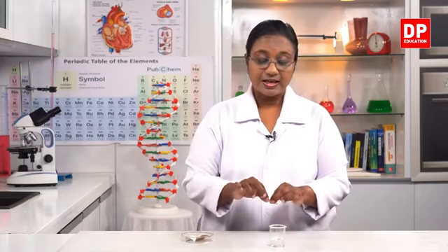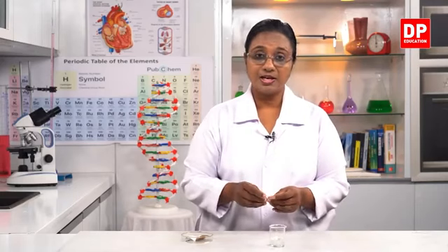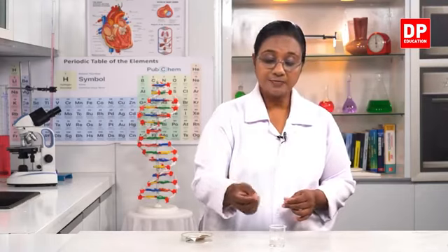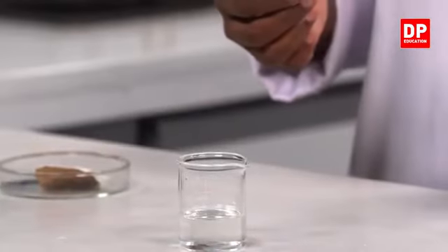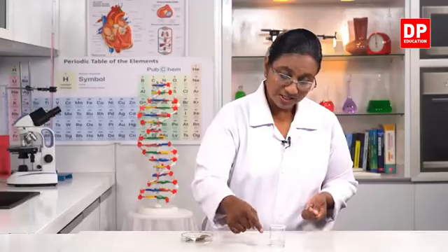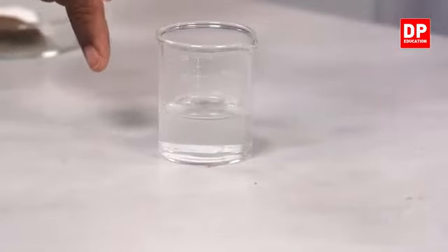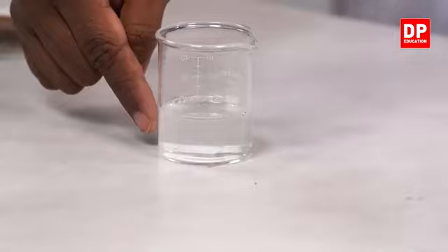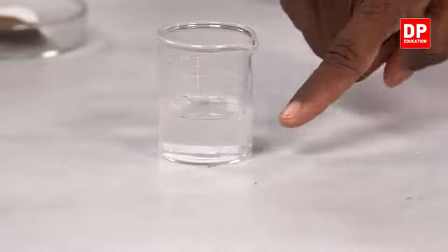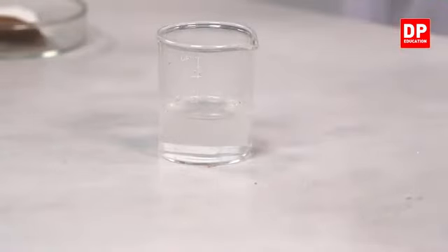So I will just break it into two pieces and put it into the beaker containing sulfuric acid. Observe the changes taking place. Now you can see the solid magnesium and the liquid dilute sulfuric acid solutions. So there you can see. Can you all see the evolving of gas bubbles? You all can see all around the gas bubbles are being evolved, and also you know that magnesium is usually more denser than water, so it goes down. And they are also from the bottom, you can clearly observe the evolving of the gas bubbles.